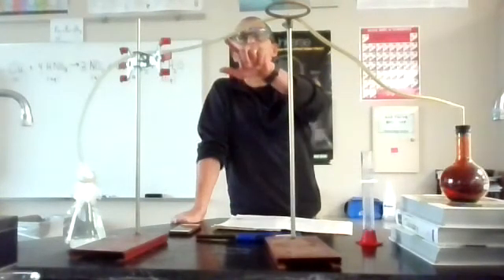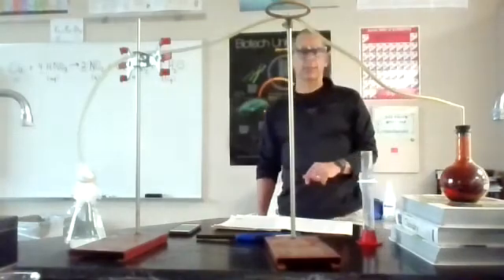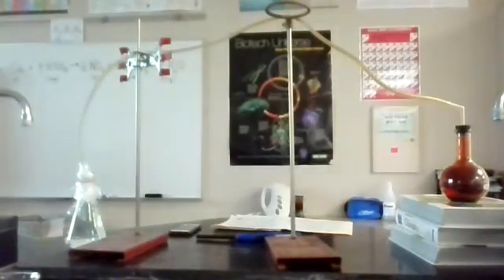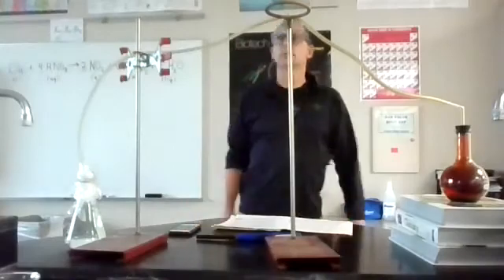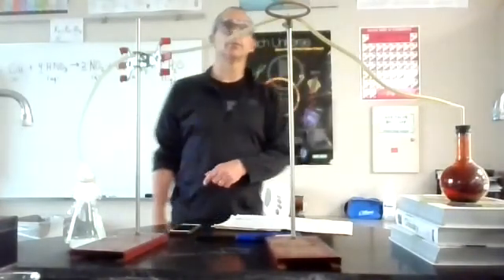Okay, we're right here. Probably what, 30 seconds? I guess that was a long minute. So probably about 30 seconds till we see some action. I think I'm going to rinse this out. Hopefully I won't miss it. Okay, now we're right here. Got the long 10-second countdown.